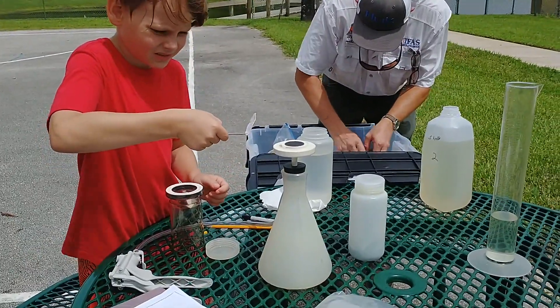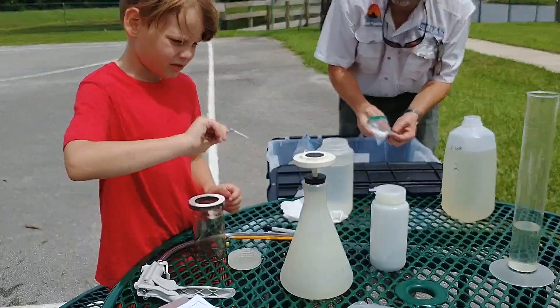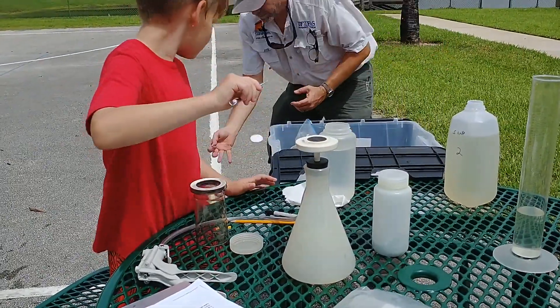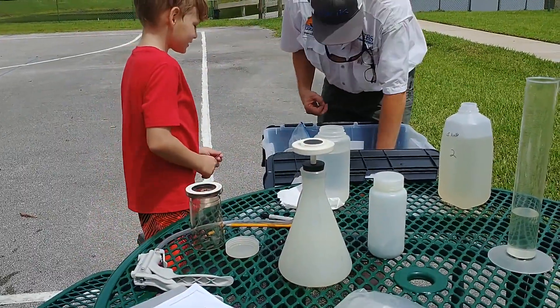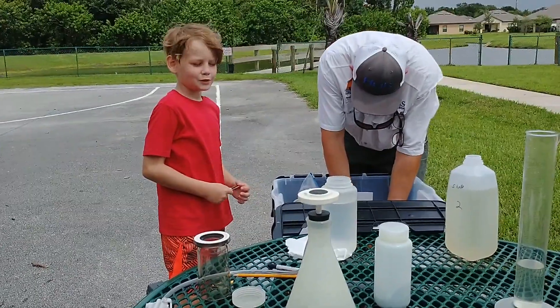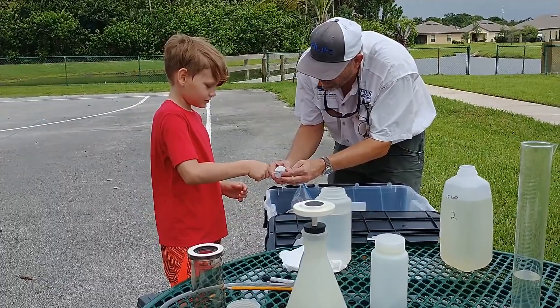It's windy. Is that the rough side? Hold on to it for just a second. Yep, that's your rough side — so put that on. You've got to have the other one ready because it's windy now. We just get one more time to practice. There you go, you got it.